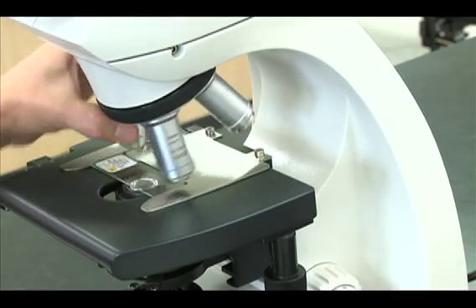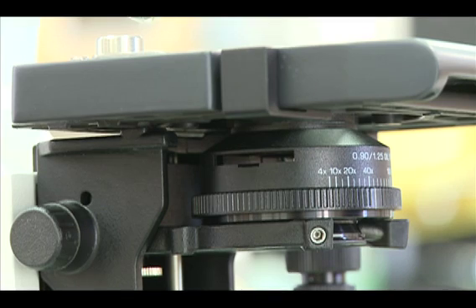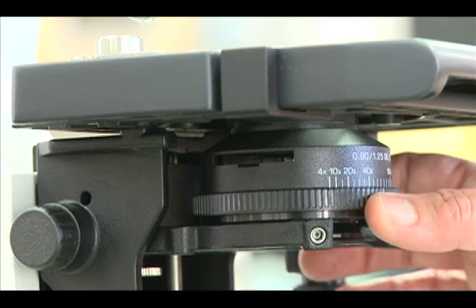Repeat these steps when you rotate to the higher powered objectives, matching the diaphragm ring setting to the objective magnification.